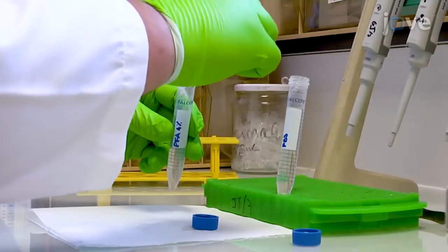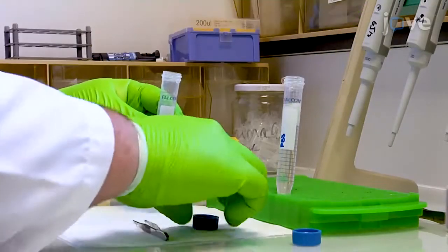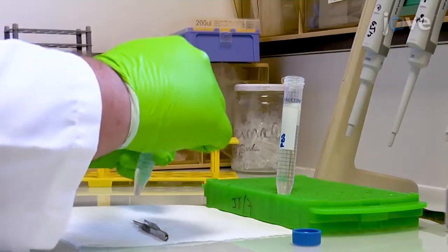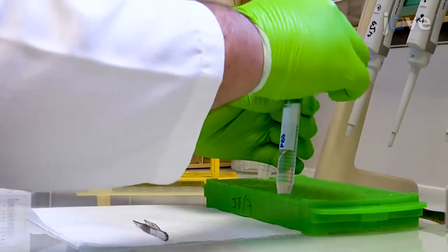The next morning, rinse the fixed white adipose tissue in 10 mL of PBS for 5 minutes at room temperature to remove all traces of fixative.